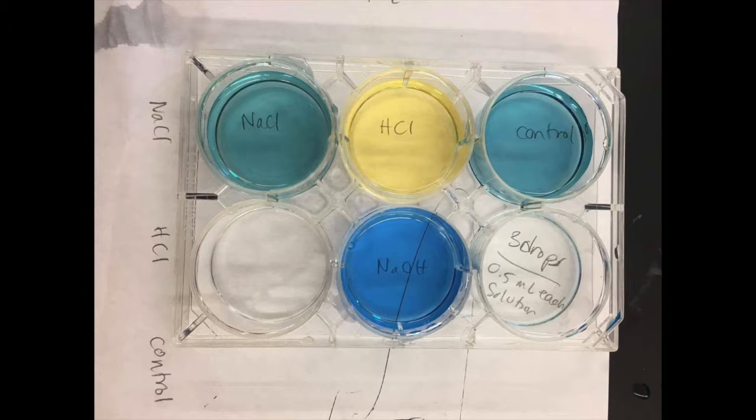The same overall concept can be applied when we add HCl into the solution. HCl dissociates into hydrogen ions and chloride ions, which would add a surplus of hydrogen ions into the solution and in turn lower the pH. The equilibrium would shift to the right to remove all the extra hydrogen ions and exhibit a yellow color.